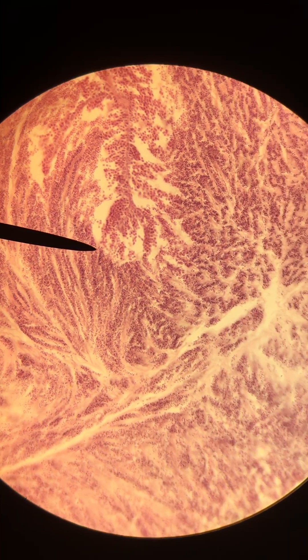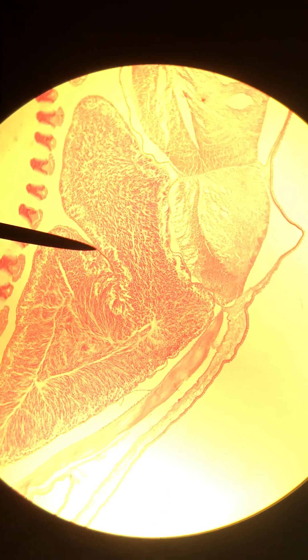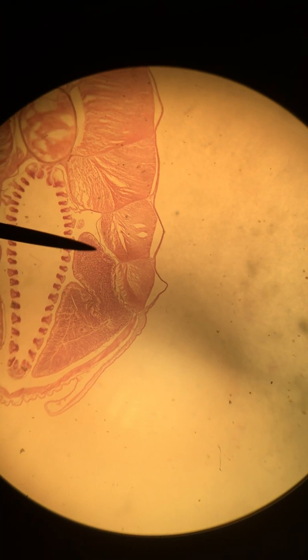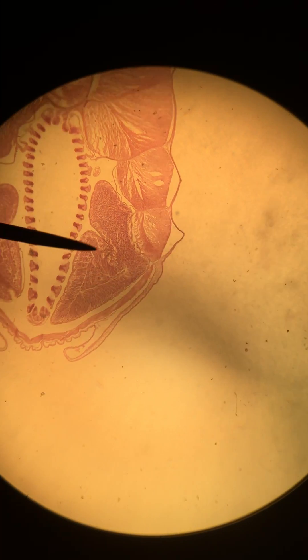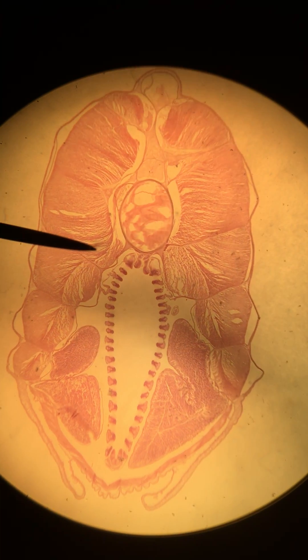You can see here — this is the highest magnification we can get — there are smaller cells with more of a punctate appearance inside the testes. This is of course producing sperm, and you should be able to tell the difference pretty easily by looking at the gonads for the male and female Amphioxus. I'm going to zoom out again to show you the larger field of view — we don't see any of those little circles here, so even at the lowest magnification you can usually tell the difference.